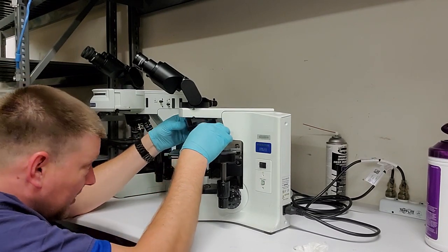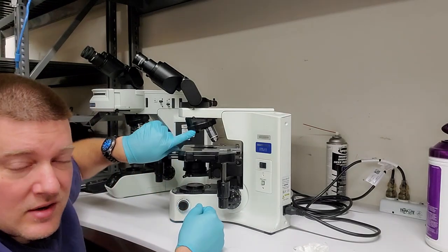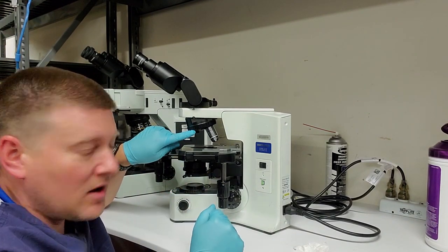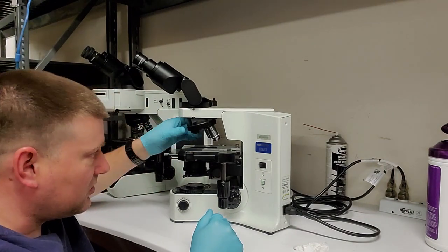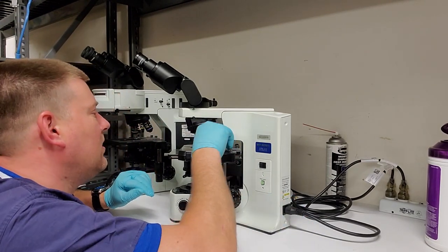Okay, so this turret here has only got two objectives. And it's got one open piece. Now that should have a cap on it, because you do not want dust getting up inside your turret and on the backside of your objectives, because that is extremely hard to clean. So I wish I had the replaceable parts to fill those two holes, but I don't at the moment, so I'm gonna press on.